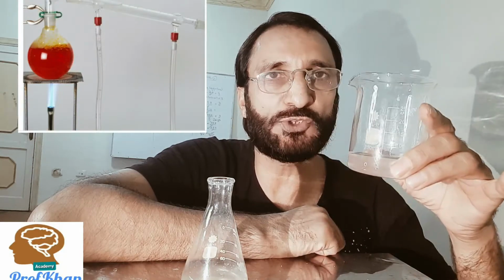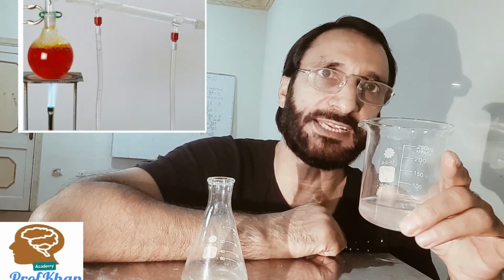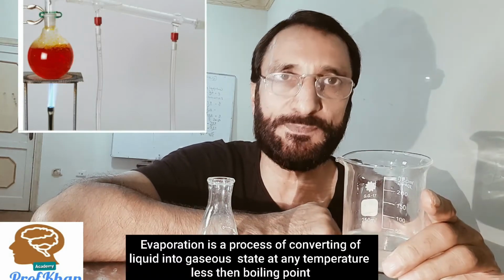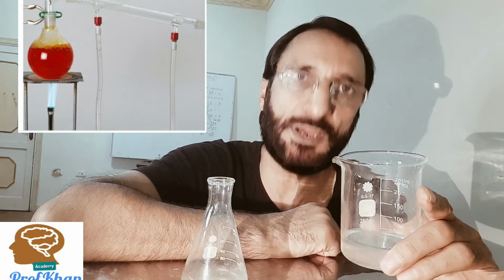In today's activity, we have a solution of salt and we are interested to separate water in one container and salt in another container. Here we will utilize two concepts. One is evaporation, we need to heat it, and then condensation, the vapors or the steam will be cooled down by some condenser.